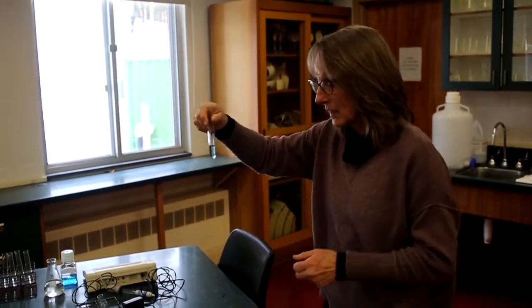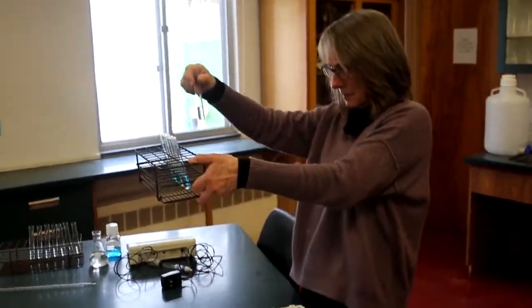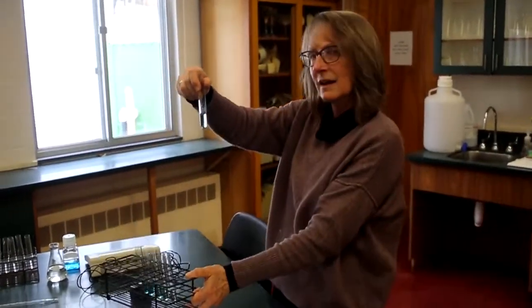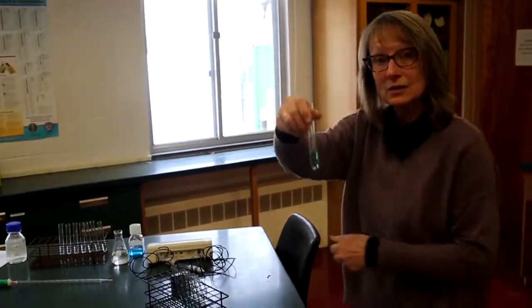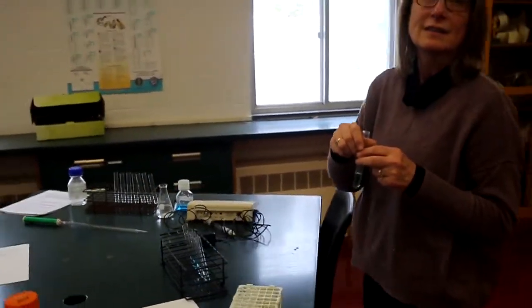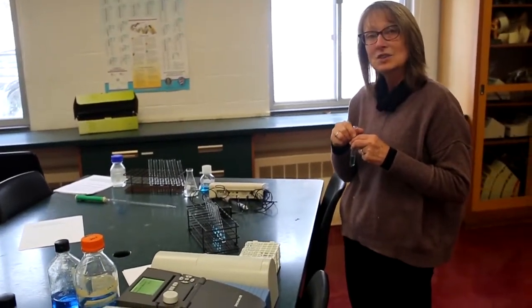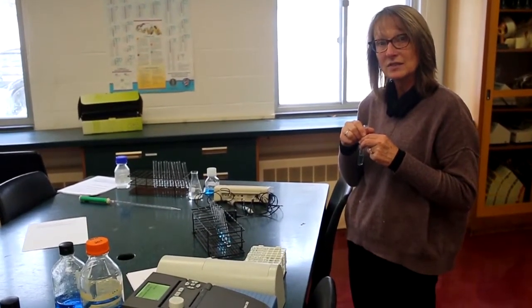So I could do a couple things. I could hold it up to some of them that I know and try to eyeball it, but I'm just not comfortable with that. So what I'm going to do is put it in the instrument, and I'm going to determine the absorbance value, and then I'm going to use that chart, that standard curve, and be clever and see how closely I can estimate the concentration of this unknown.